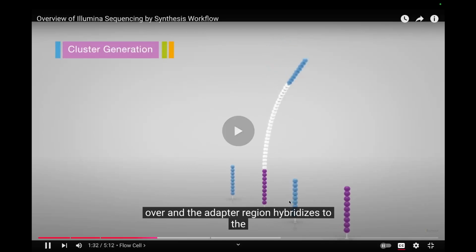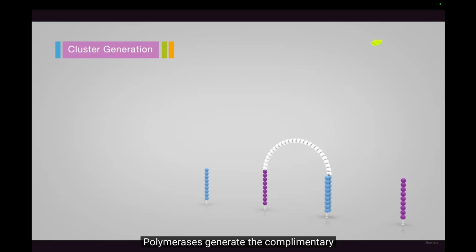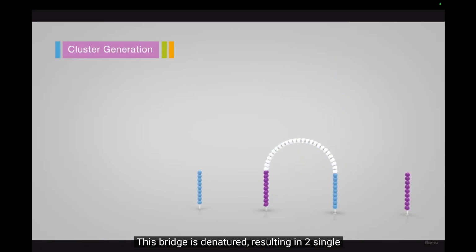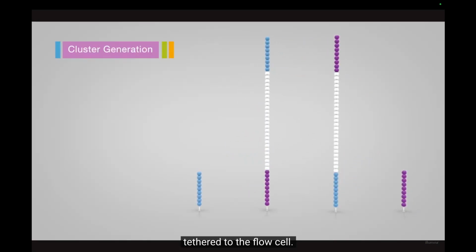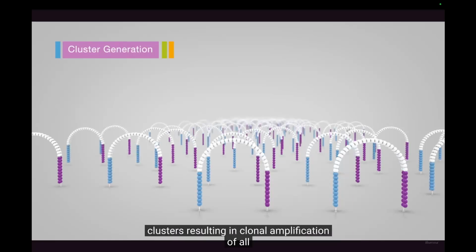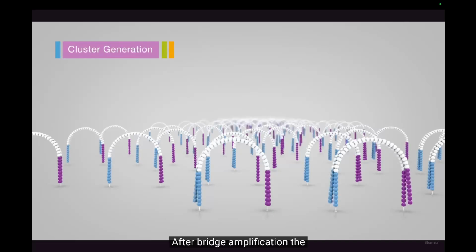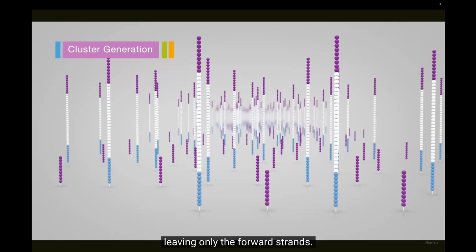The adapter region hybridizes to the second type of oligo on the flow cell. Polymerases generate the complementary strand, forming a double-stranded bridge. This bridge is denatured, resulting in 2 single-stranded copies of the molecule that are tethered to the flow cell. The process is then repeated over and over and occurs simultaneously for millions of clusters, resulting in clonal amplification of all the fragments. After bridge amplification, the reverse strands are cleaved and washed off, leaving only the forward strands. The 3' ends are blocked to prevent unwanted priming.